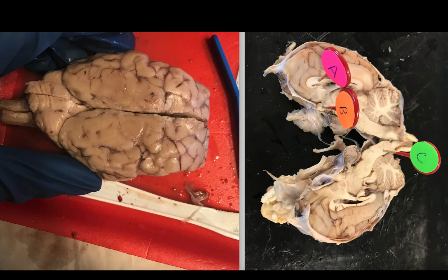Today we are going to look at a dissection that I performed on a sheep brain. The structures are very similar to the human brain, however the brain is slightly more simplistic and much smaller than the human brain. I have decided to use images in this lab instead of the lab footage simply because it's easier to point out the features to you.